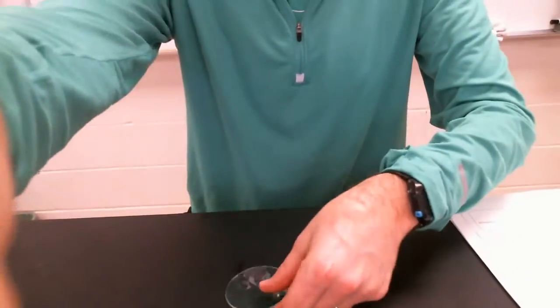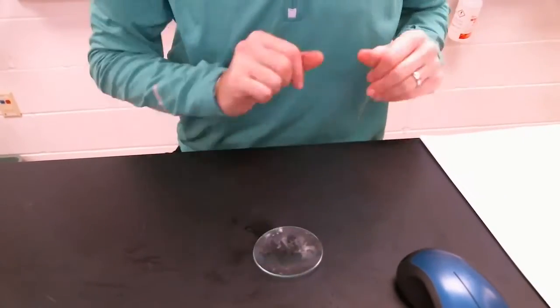And what we're going to do is go through 11 demos today, 11 examples of this. And for each of these, you need to A, make some observations on a separate sheet of paper, and then B, respond accordingly, answer the question: is it a physical or chemical change? So let's get started. Adjust my camera, show my workspace. There we go.